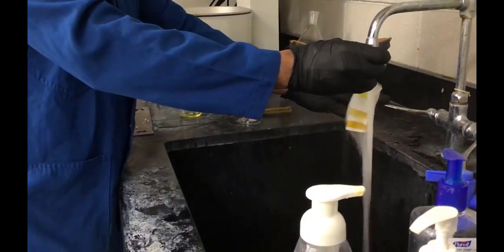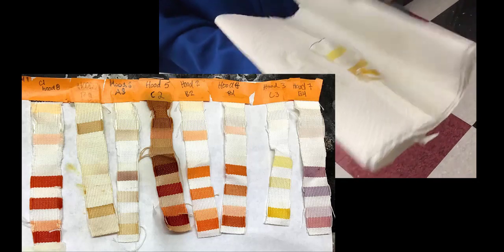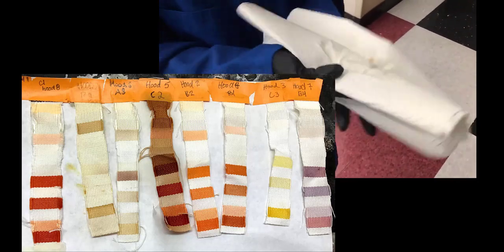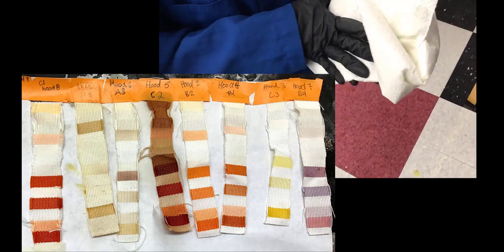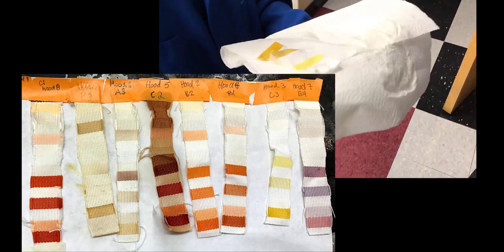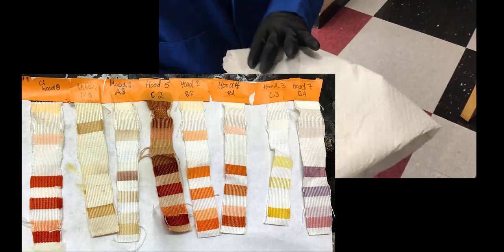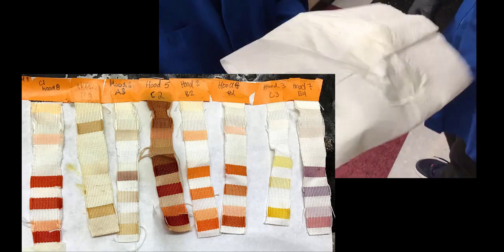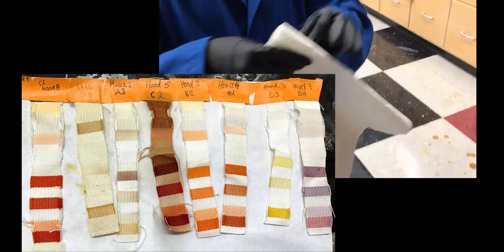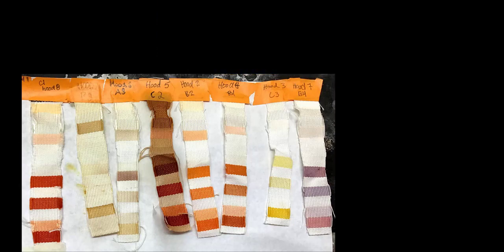What would normally happen in the lab is you would take the cloth that you stained with your specific azo compound and compare it to everyone else in the lab. And so here we have comparing the C3 to C1, A3, C2, B2, B1, B4. All right, so you have all of those options in order to compare. And so you can kind of tell how most of the same segments were stained. There's slight differences between each compound in terms of what they stained. So this is an observation that you want to put in your lab report.